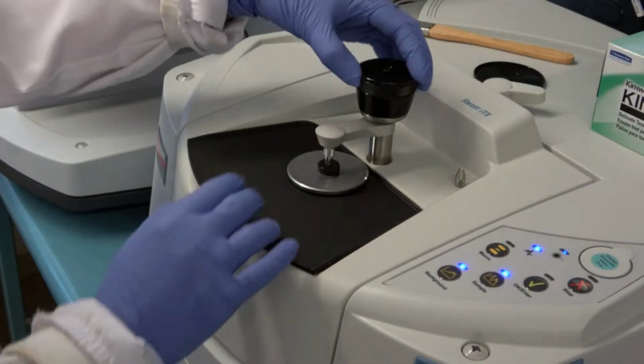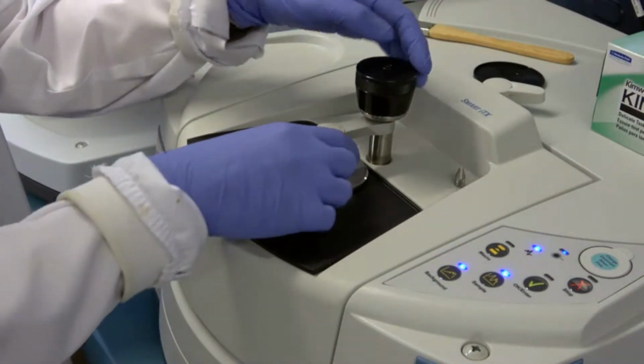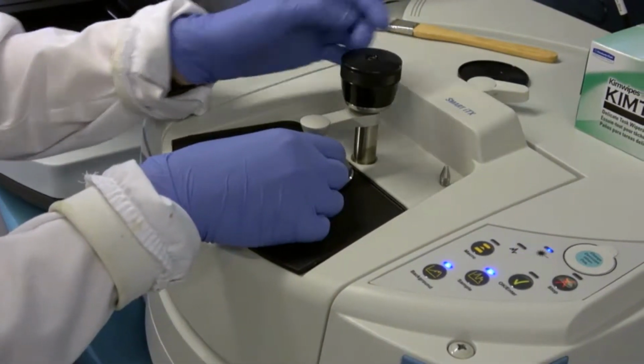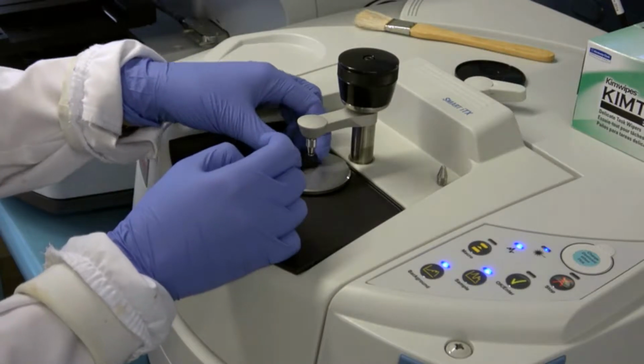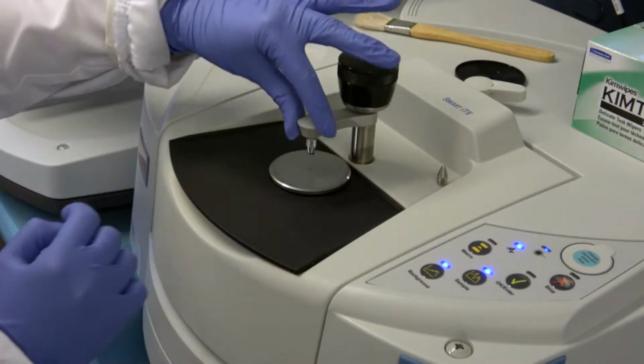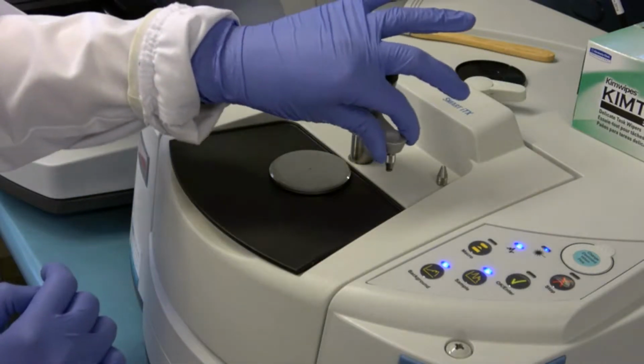In order to do an IR spectra, the pressure pin is unscrewed by turning it to the left. Underneath, there is a black disc that protects the sample holder from scratches and possible contamination. The arm is moved away from the sample holder to increase the accessibility to the plate.